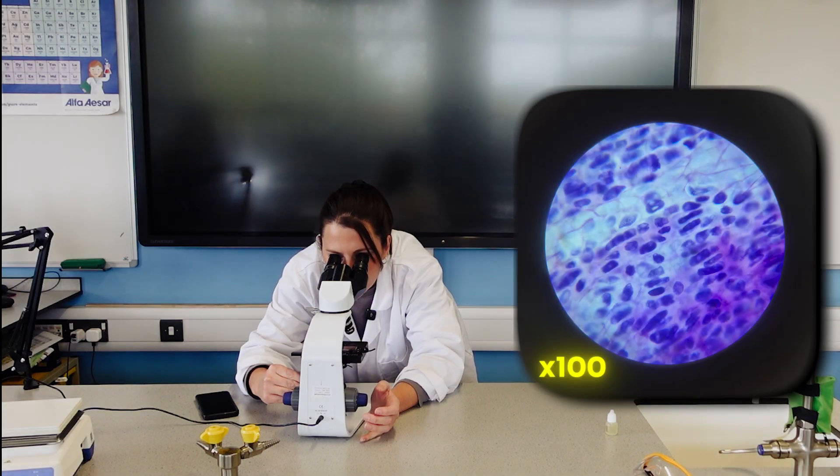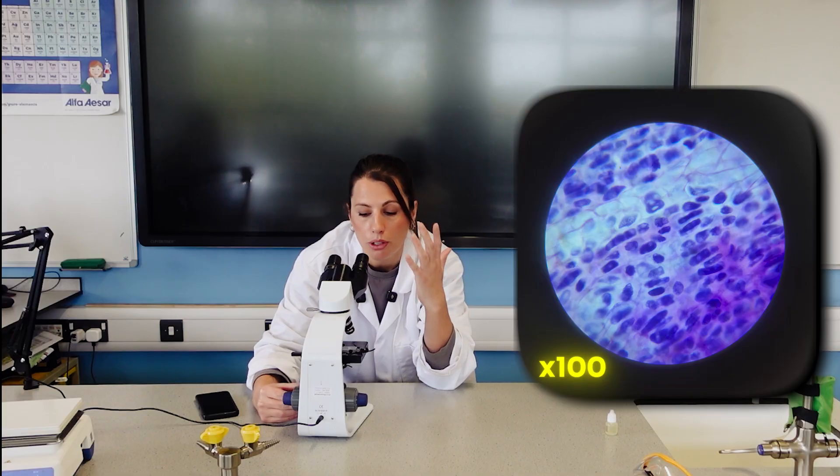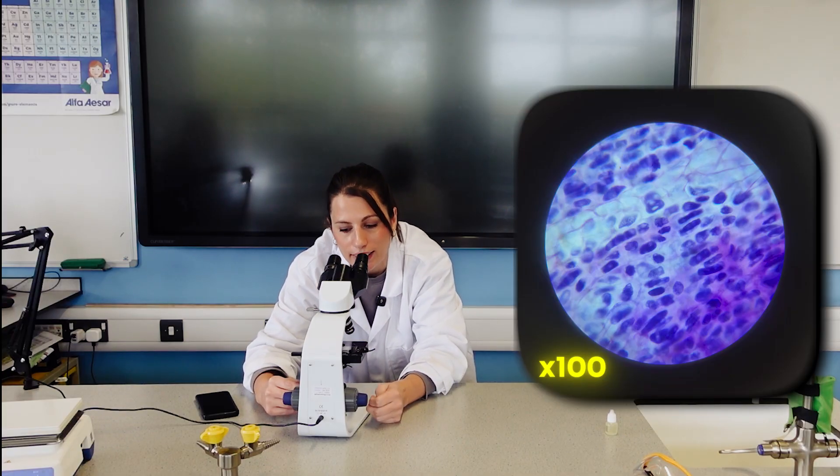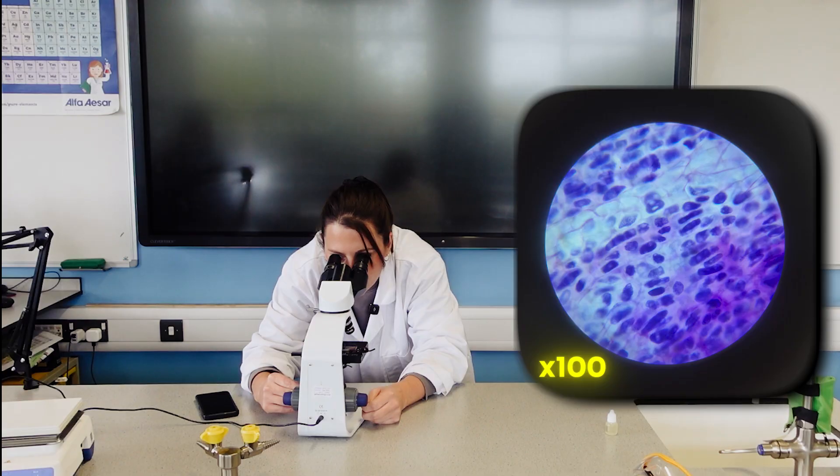Now I have managed to find it without having to go all the way back up to the lower magnifications. So now, and it's just focusing. The hardest bit now is I've got it in focus and I can see all the cells, but this is when students now need to have quite a bit of patience.